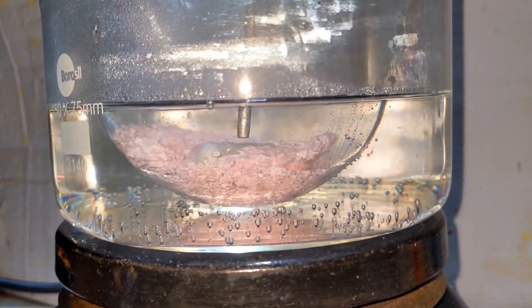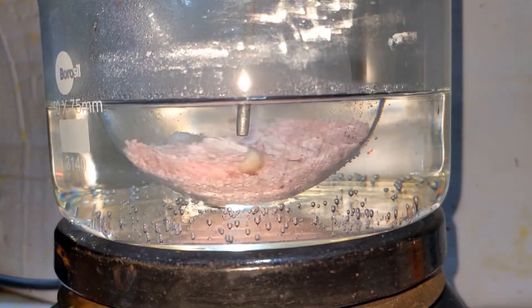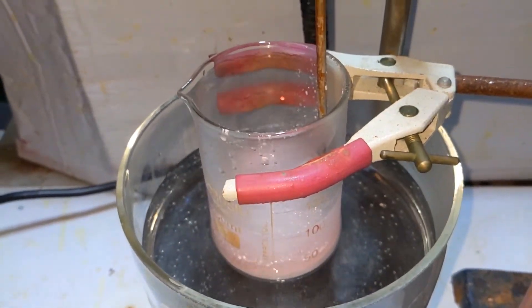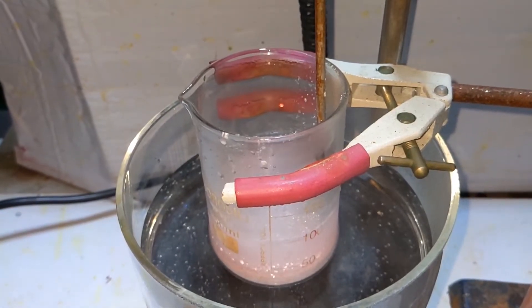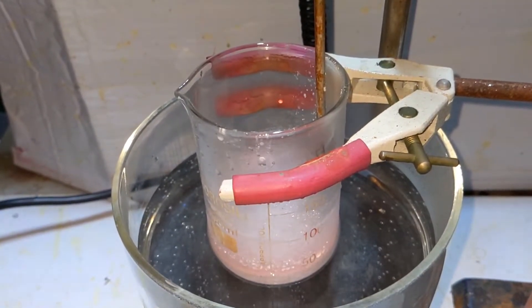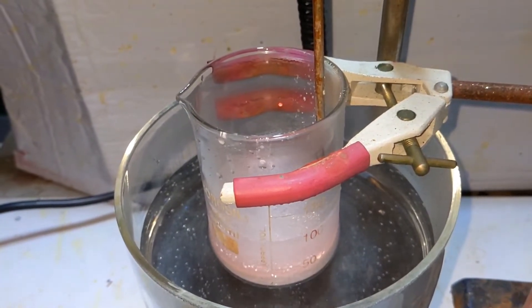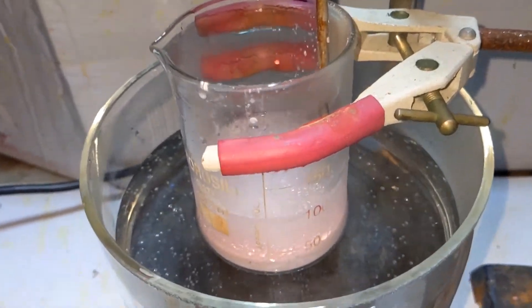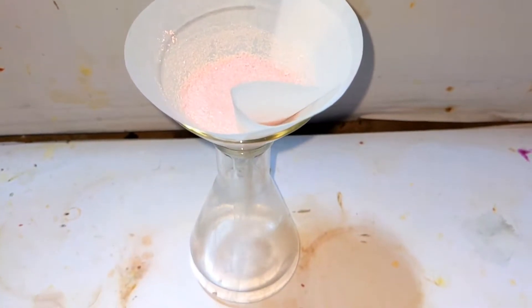As a net result, the product was easier to crush and I was able to transfer it into another beaker, repeating the same procedure there. I chose a beaker so that the vapors of the thymol can easily escape, and the supernatant solution was drained out periodically as more water was added. This helped to remove most of the unreacted thymol.